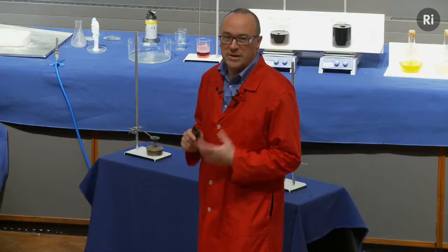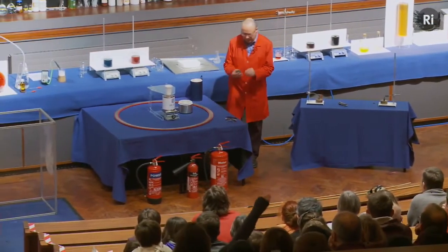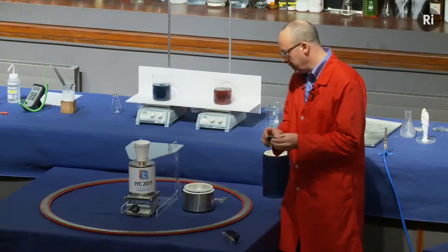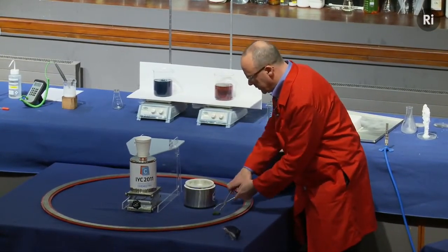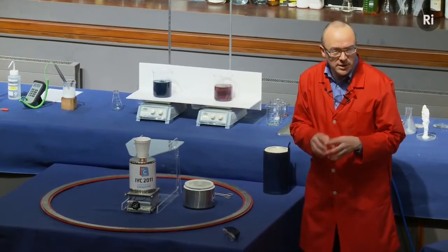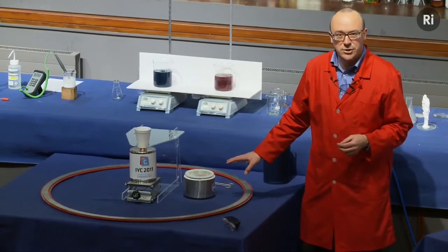We're going to look at the first of these, yttrium. Now, yttrium can be used to make a compound, and I have some of the compound here. It's called yttrium barium copper oxide, and it's just a hard black lump of ceramic material. What I'm going to do is to put it into some liquid nitrogen. And so that yttrium barium copper oxide is now being cooled down to minus 196 degrees. That takes a moment or two to cool down.